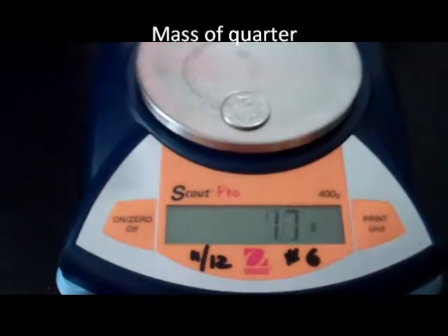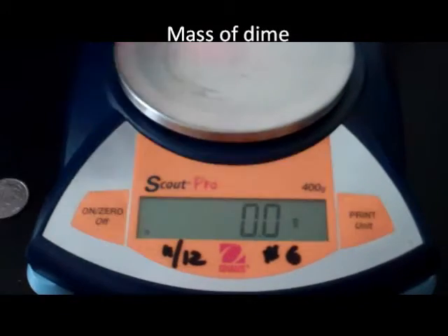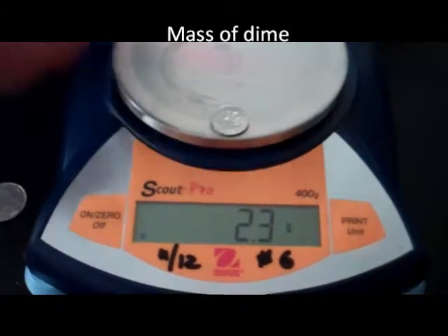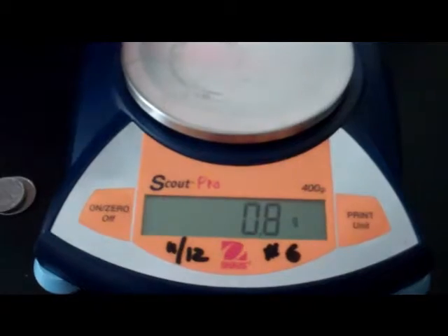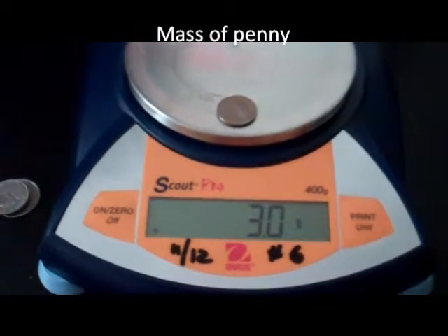Now I'm going to find the mass of a quarter, dime, nickel, and a penny. The mass of the quarter is 5.7 grams. The mass of the dime is 2.3 grams. The mass of the nickel is 4.9 grams. And the mass of the penny is 3.0 grams.